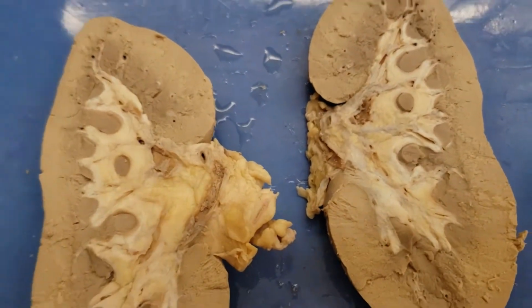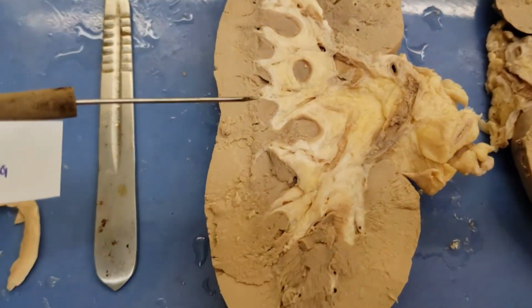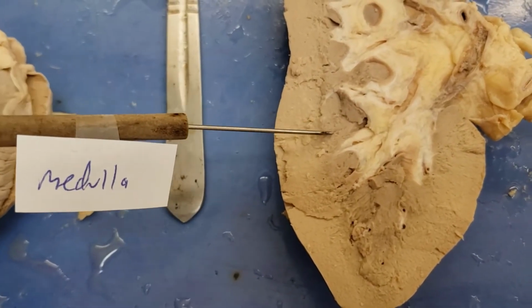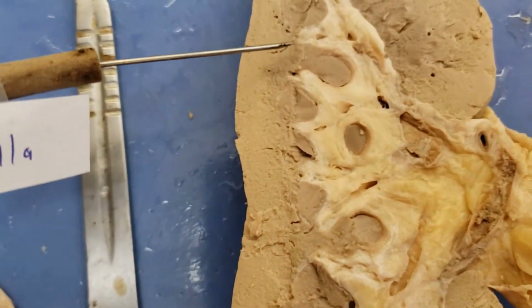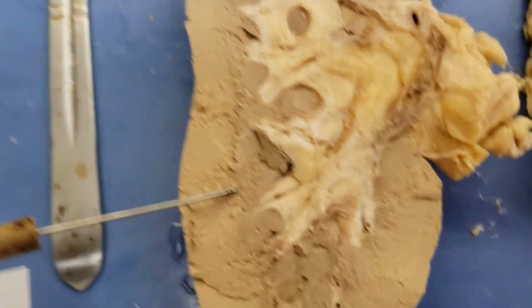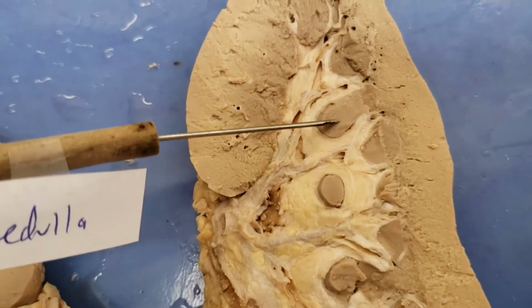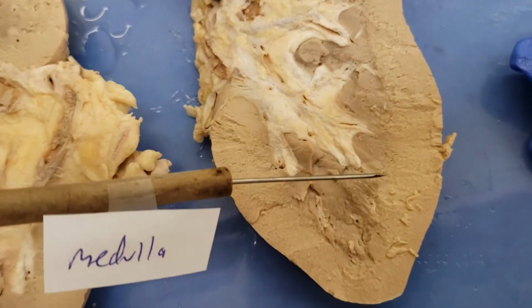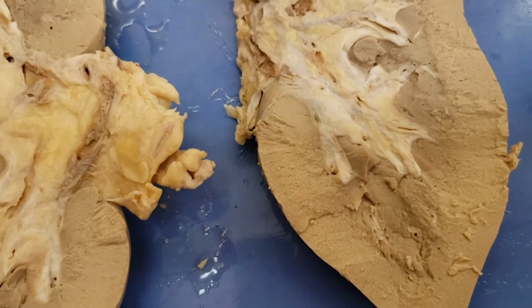Okay, now the next is the medulla, the middle part, right? And this is a little tricky, but you have to look for this discoloration that's present. So this area here represents the medulla. And so it's a little more obvious in real life, less so on the video I'm seeing, but it's this region. It's kind of the medulla. You can see it over here too. Medulla. And so you see these little dots. Those have their own names, so we'll talk about in a second. But those are structures found in the medulla. It's the middlemost layer. Got that. Okay.